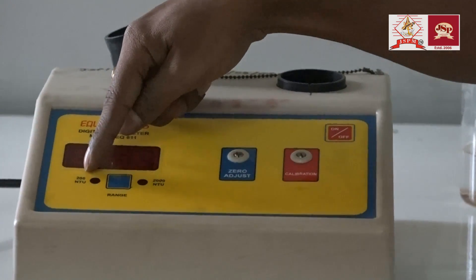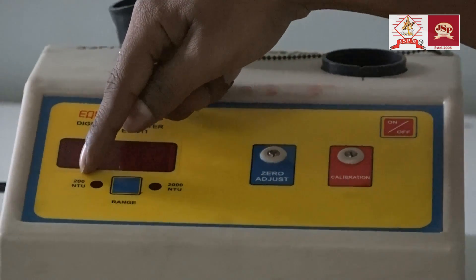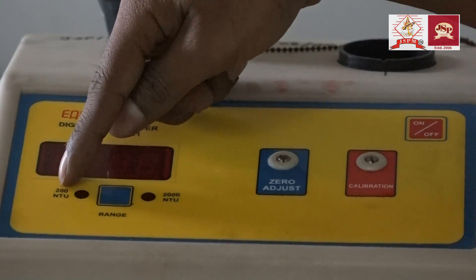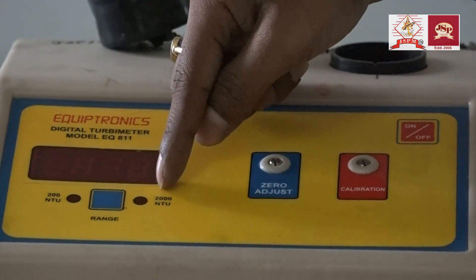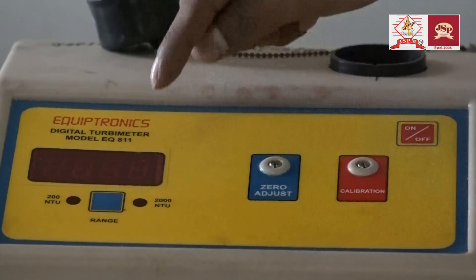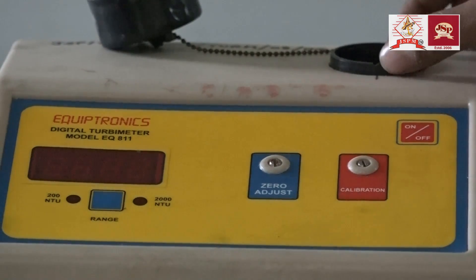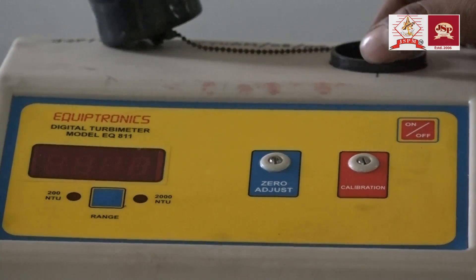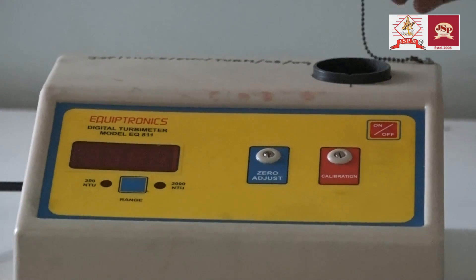The first range is 200 NTU. That will be used by keeping this lid onto it.